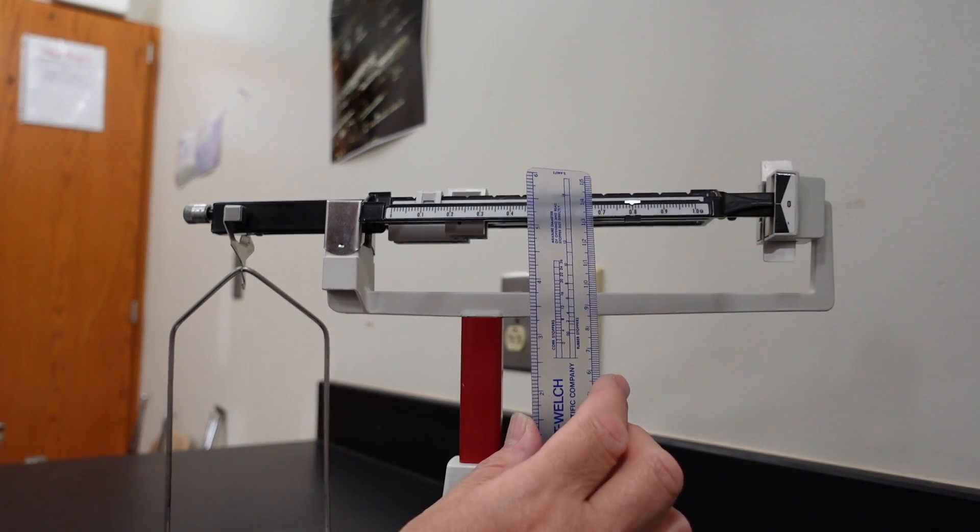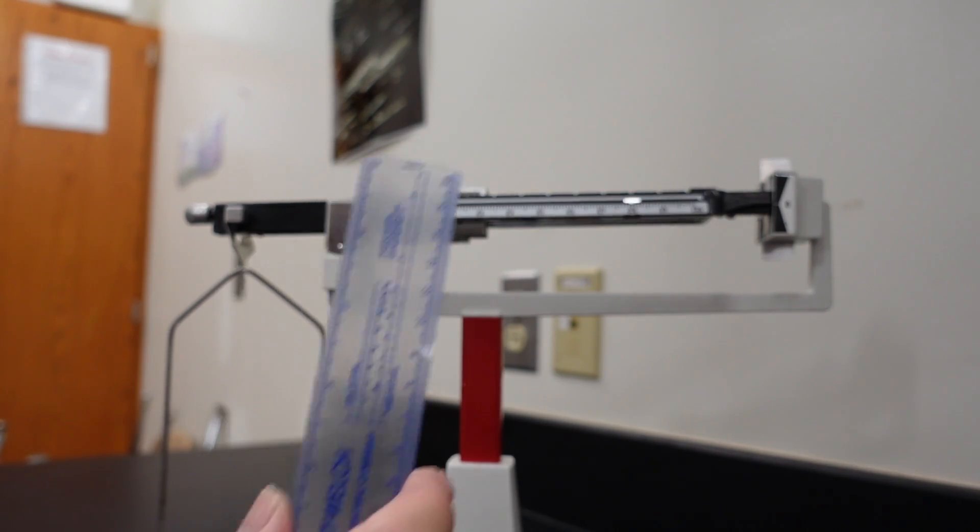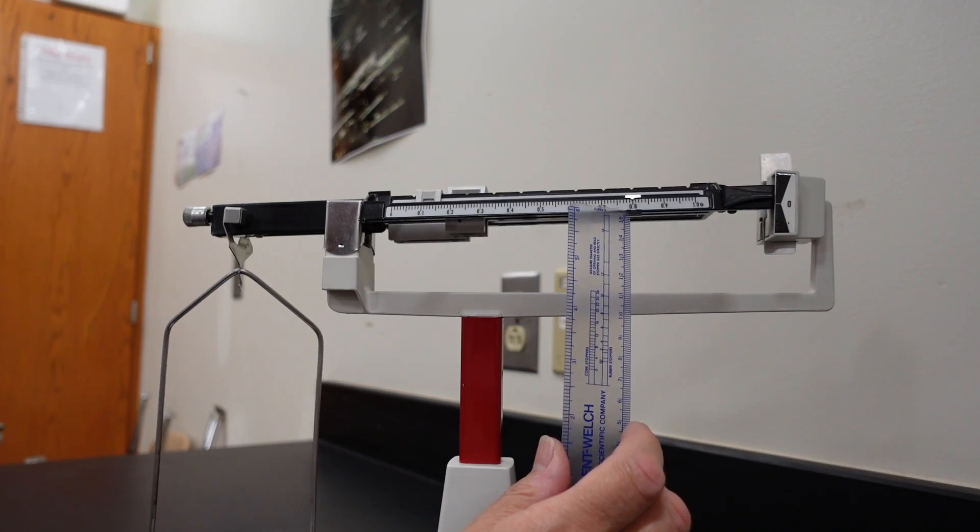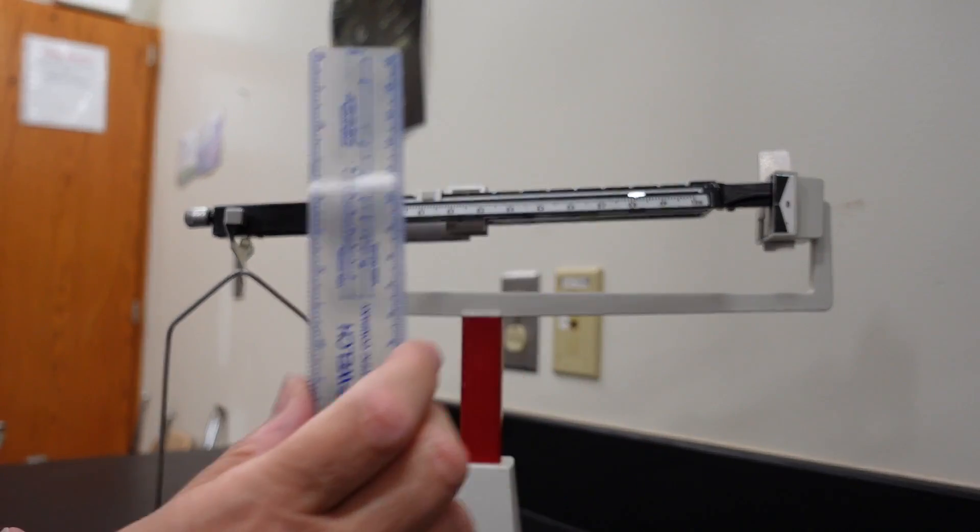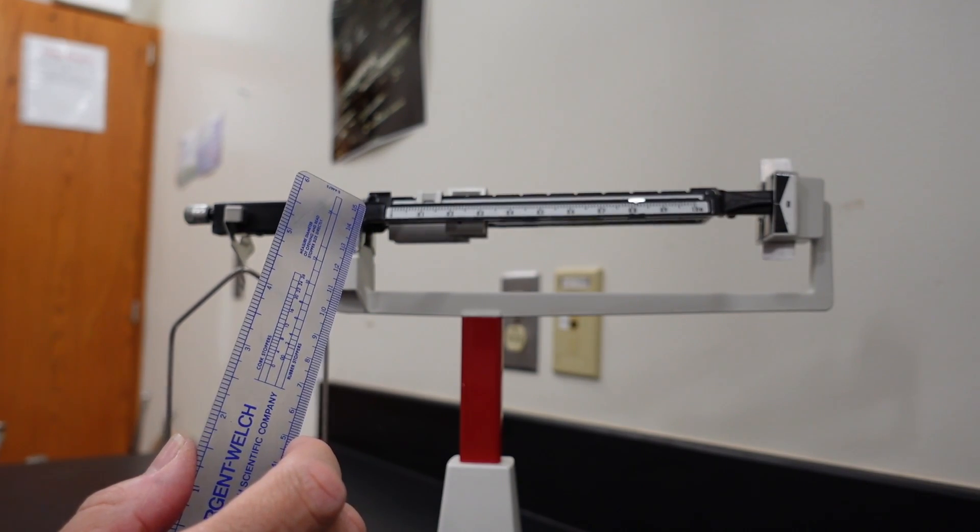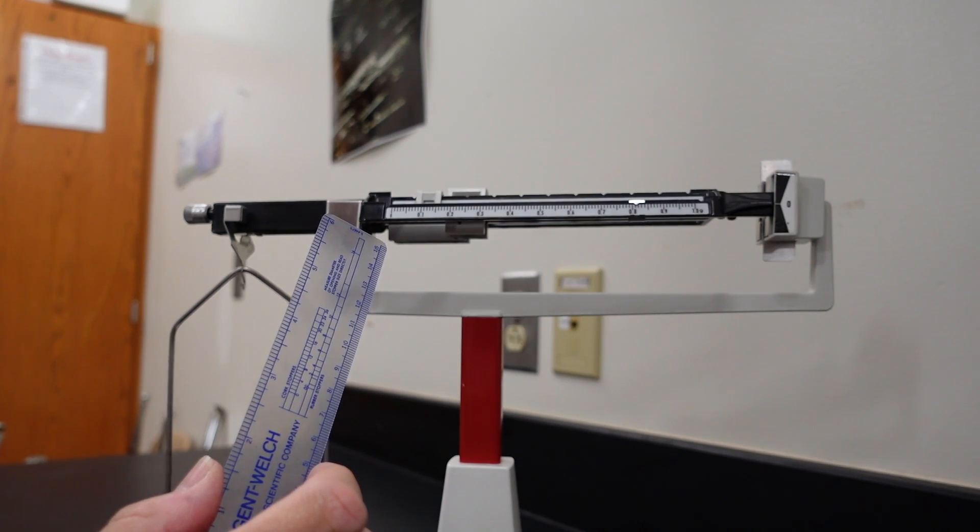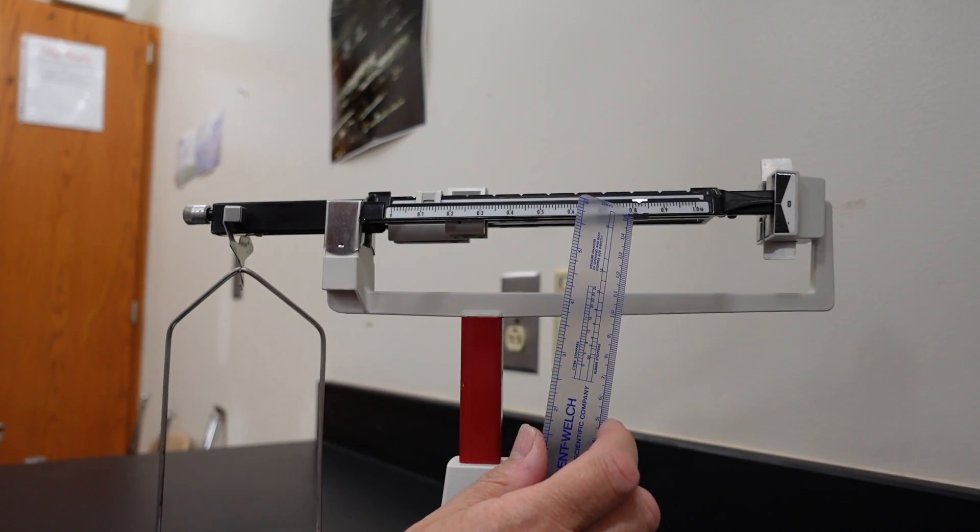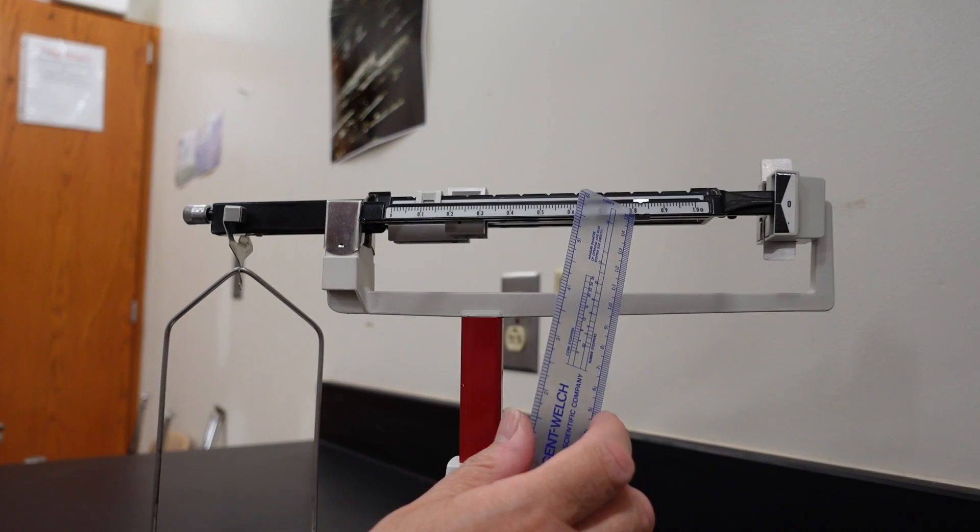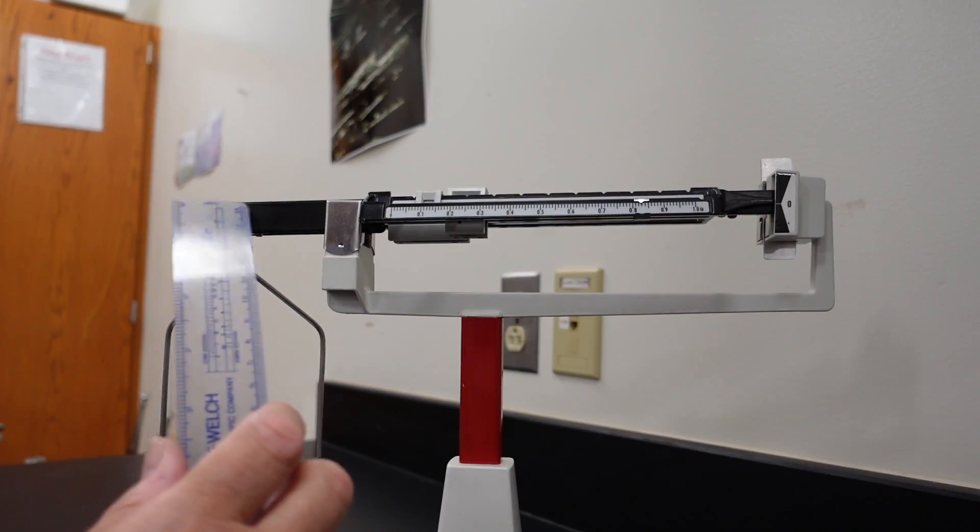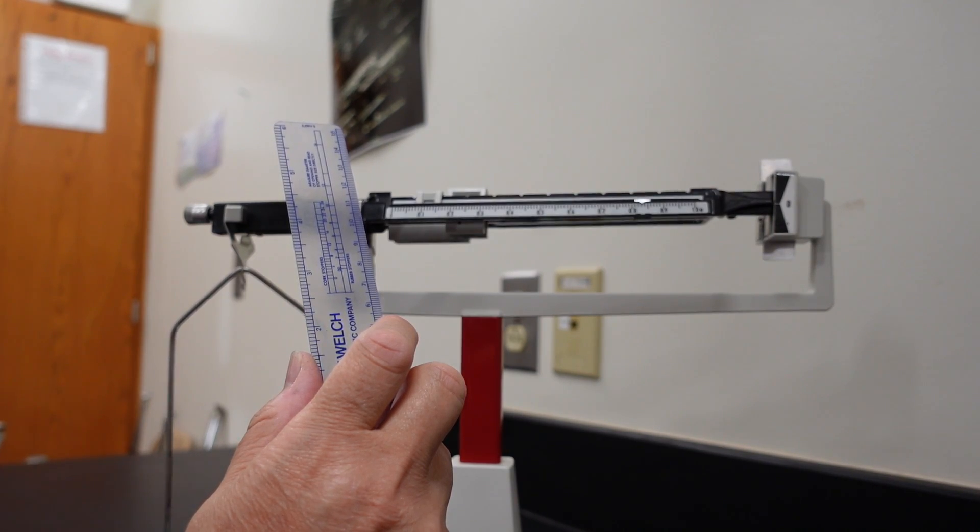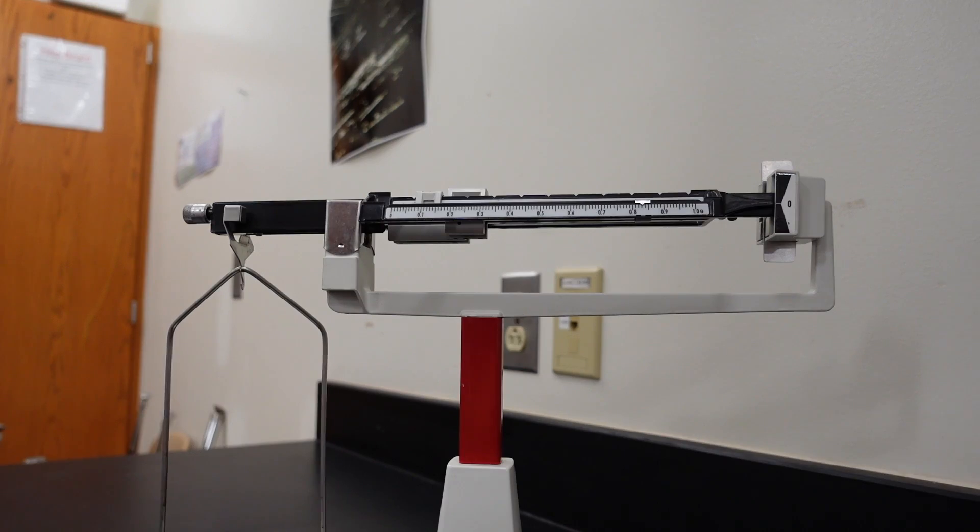This particular part is so fidgety. It's going to be the part that would take you the most time to actually adjust. Now, they do make digital versions of this. But, as far as this class is concerned, that's cheating. Okay. Let's see if we're there yet. Just a hair more. And, just a half a hair more. Maybe more than that.